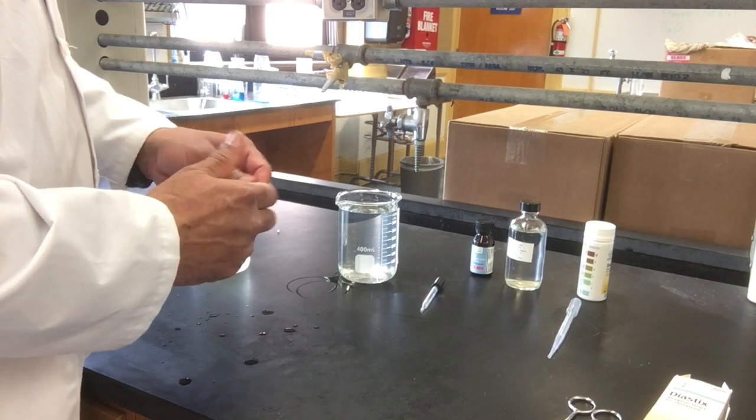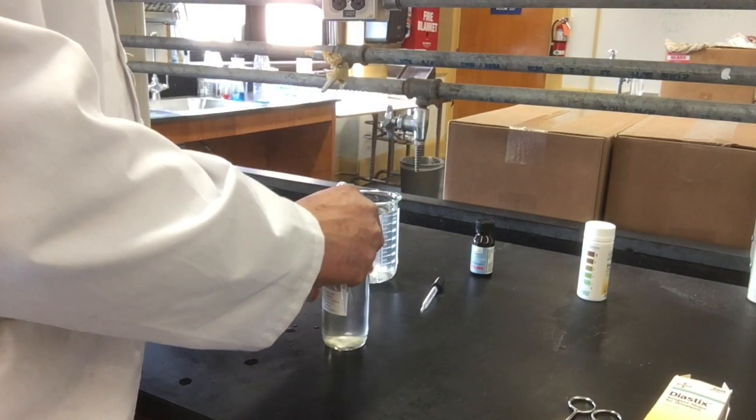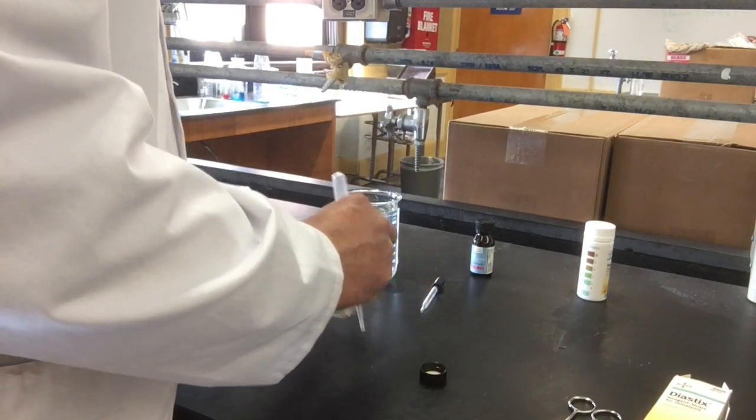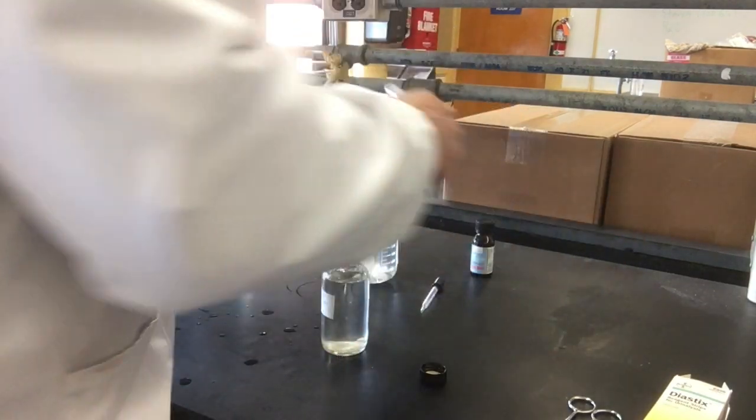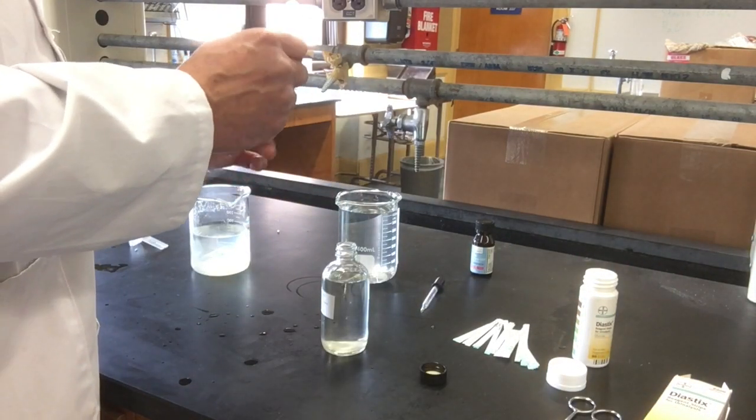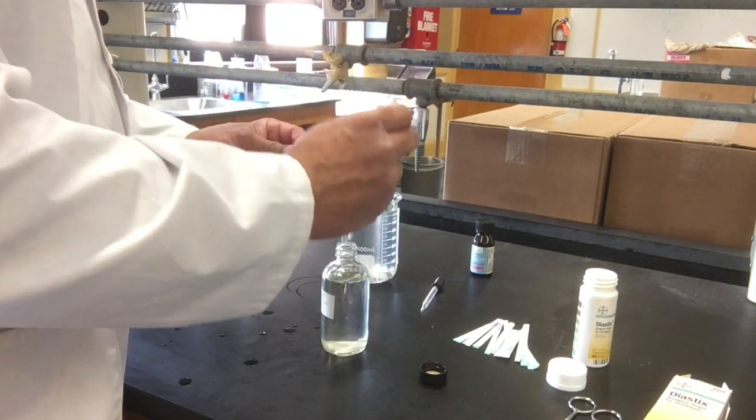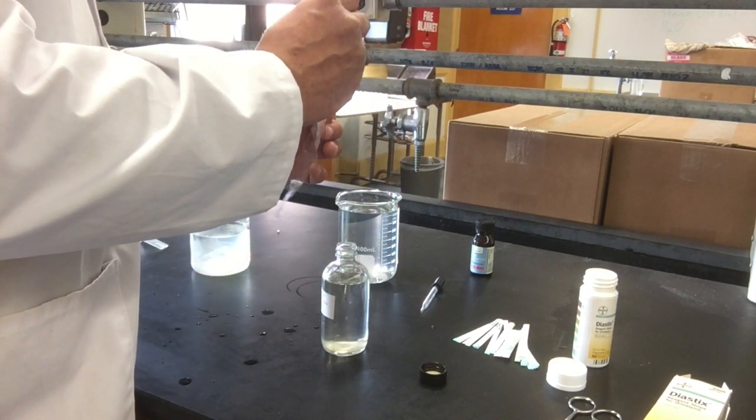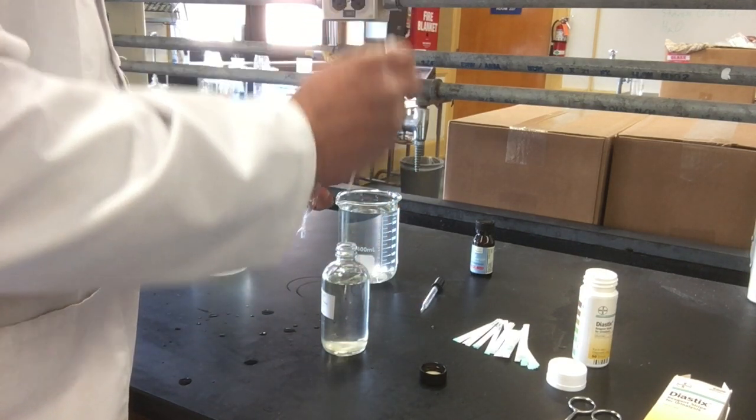I rub the end to open the bag. Now I'll fill it with the glucose-starch solution using a pipette.